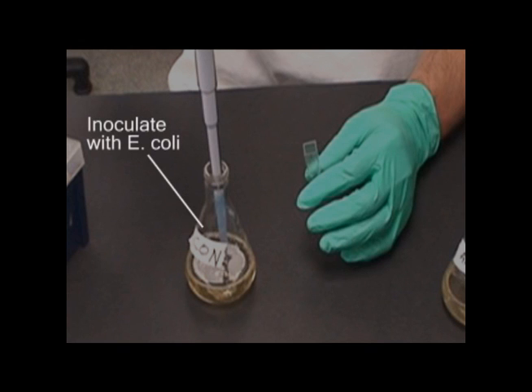In a similar manner, three milliliters of stock E. coli are added to the con flask, effectively inoculating the flask. Swirl the flask to mix the contents.